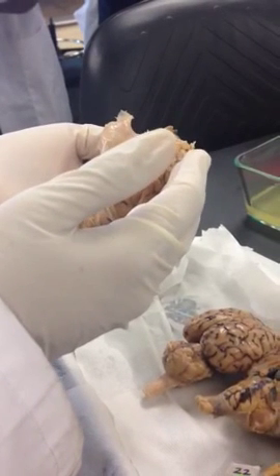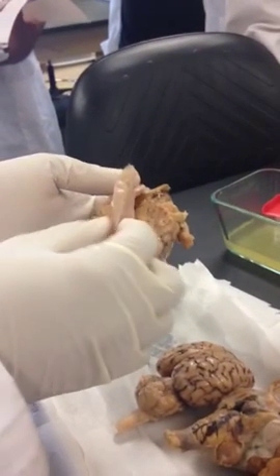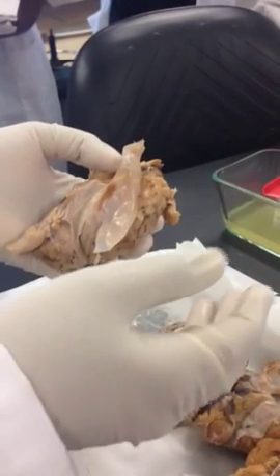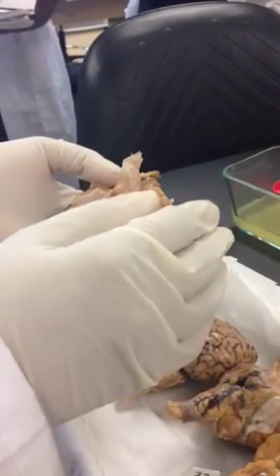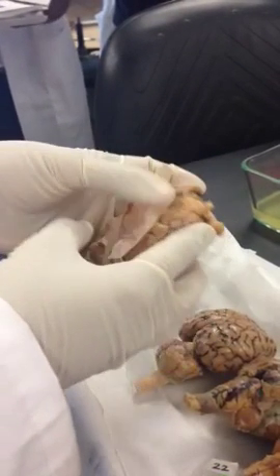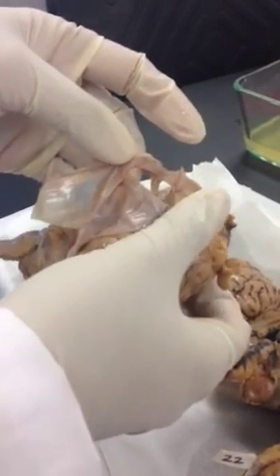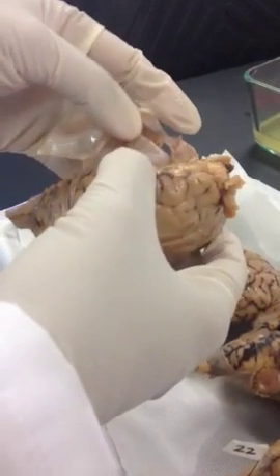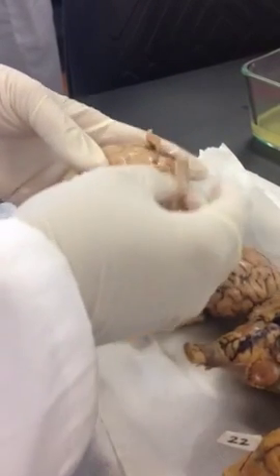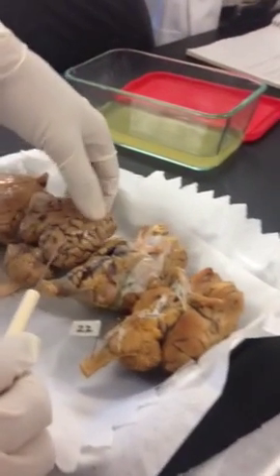The pia mater is the surface of the brain, and they have spaces between these three layers depending on whether it's above or below. You call it epi or sub, like epidural space, subdural space, subarachnoid space. So for example, the subarachnoid space is below the arachnoid matter and the pia mater. That's where you'll have cerebrospinal fluid lubricating the brain. Okay, so that's for the meninges of the brain, and we will first do the superior view.